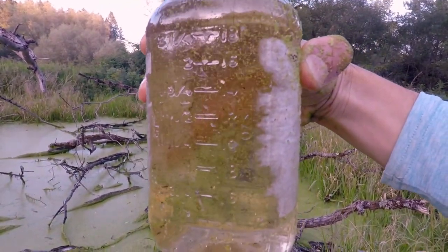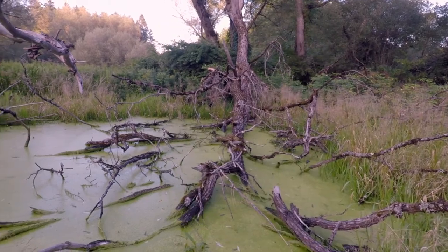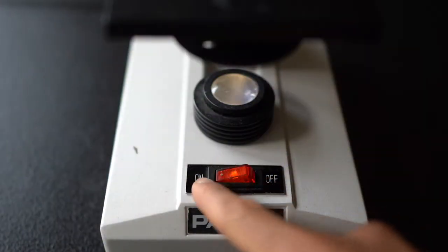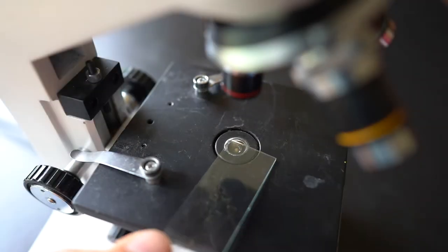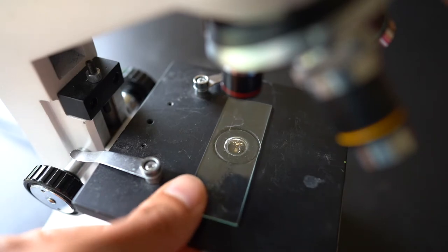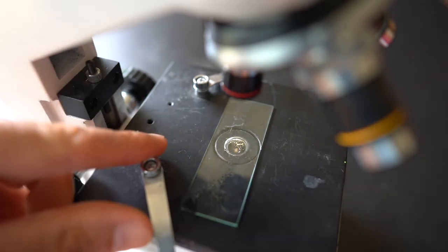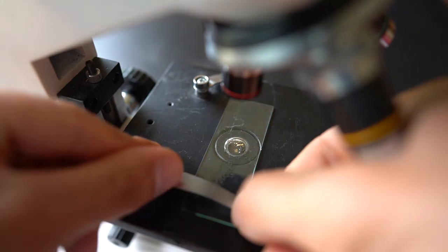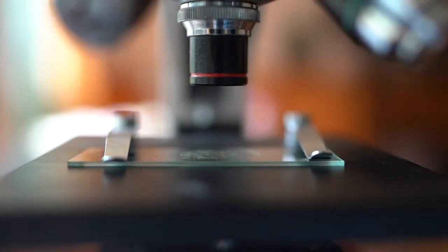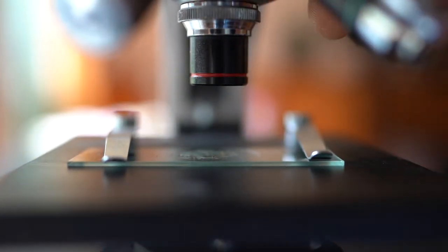So we're going to use the TPUC method. Number one, turn your microscope on. You would be surprised at how many people forget to do that and wonder why they can't see anything. Next step, make sure you select the correct power.